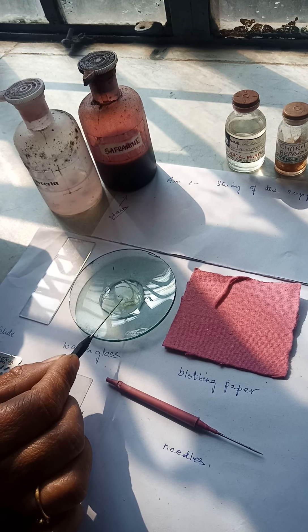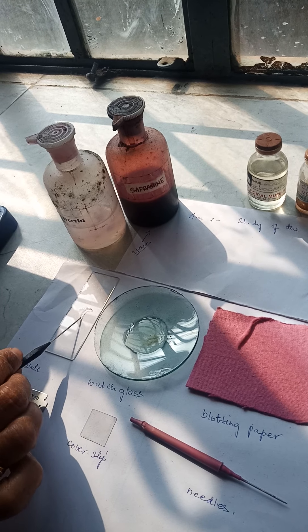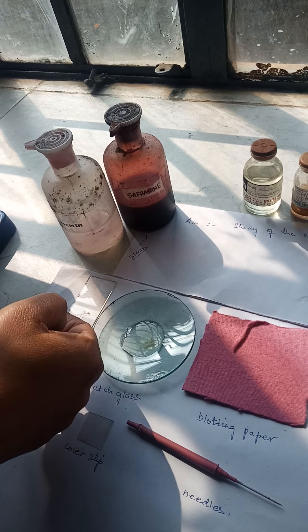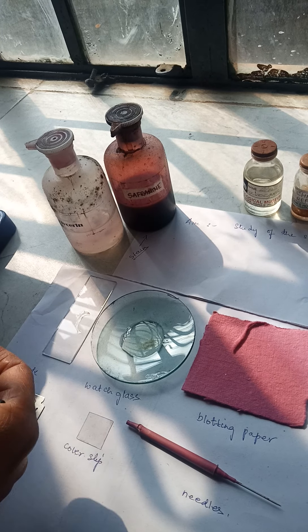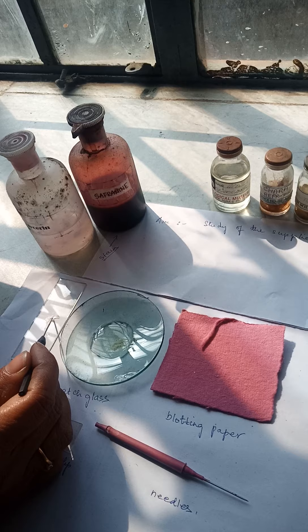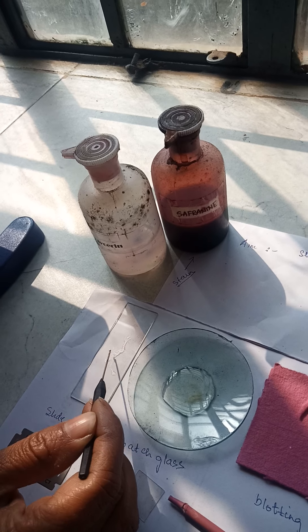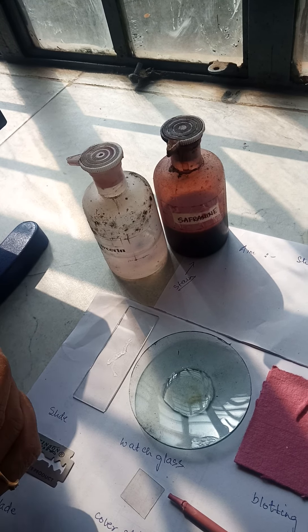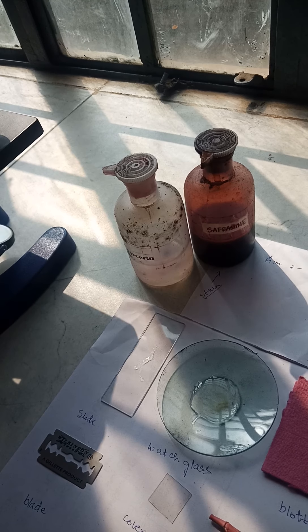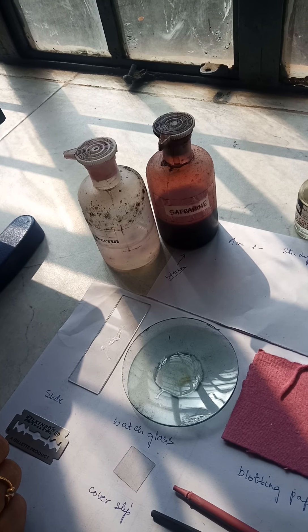You will use the needle to tap the specimen gently and spread it so it does not remain in one corner. For example, if I take this specimen and place it on the slide, I use a needle — I cannot use my finger or nail, because the algae is so small it could get under my nail. With the needle, you spread your specimen like this. These are the few things you'll need when you do your practical.